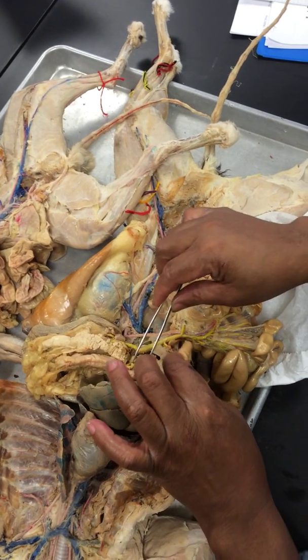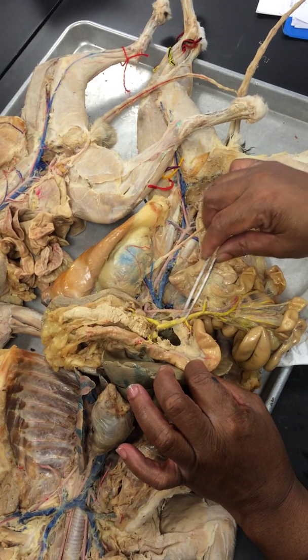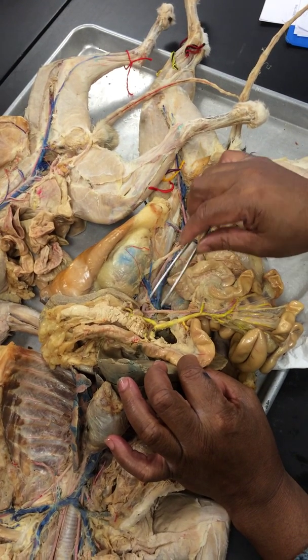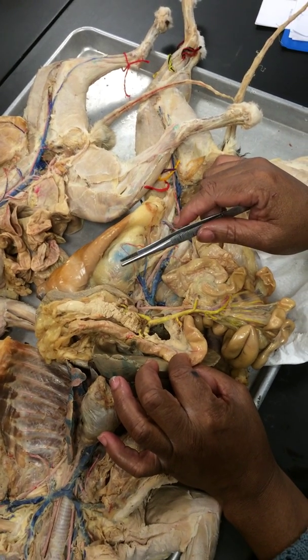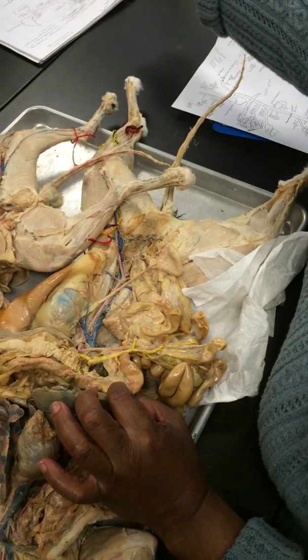So these two, if I wanted to trace from my duodenum or from my pancreas, I would use one of these two vessels. And if I use the inferior, it would empty into the superior mesentery, and if I use the superior one, it would empty into the hepatic portal. So where's the diagram? Can you see, you follow? We're here. Okay, so that's what it's showing there.